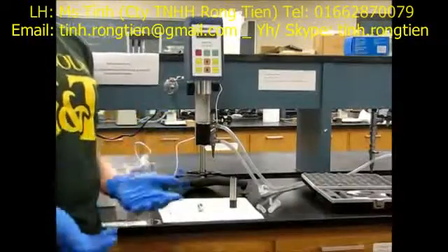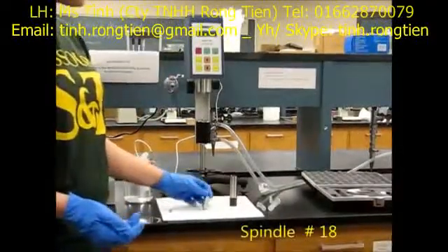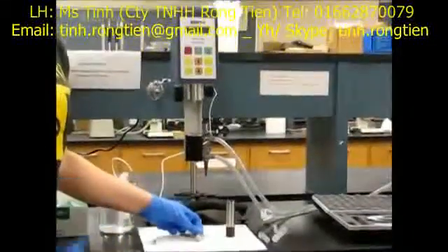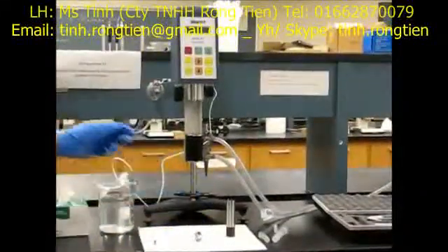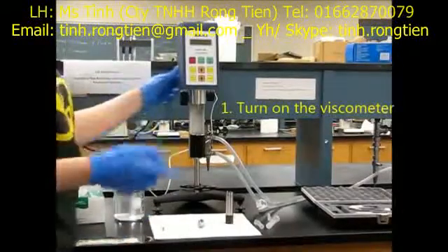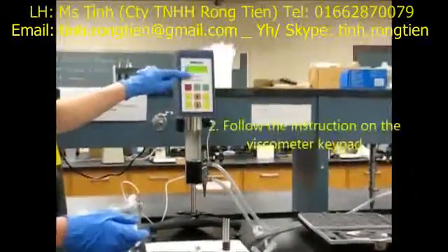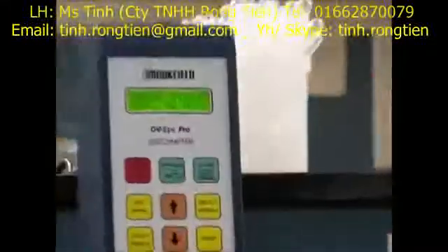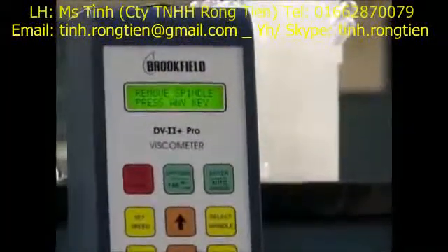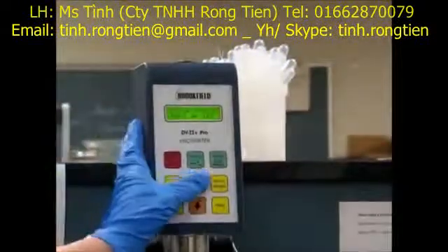For the purposes of this experiment, we're going to use spindle number 18, which has an 18 on its stem. The first thing we're going to do is turn on the viscometer with the on/off switch on the back of it, and follow the directions on the keypad. It tells us to remove the spindle — we don't have one attached — then press any key.